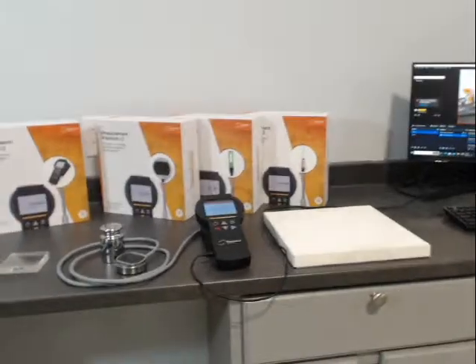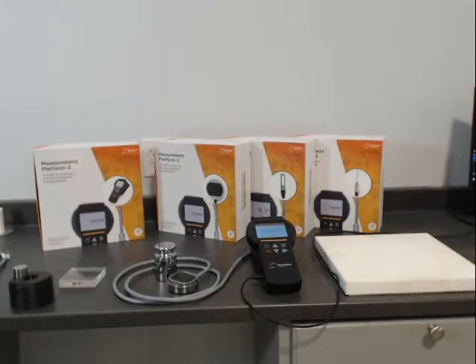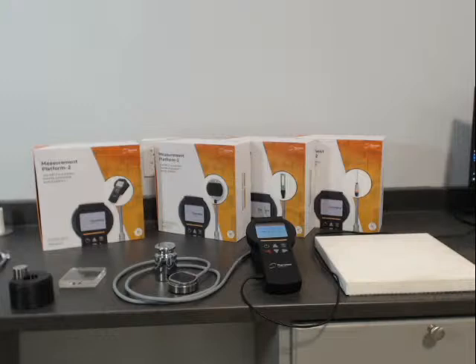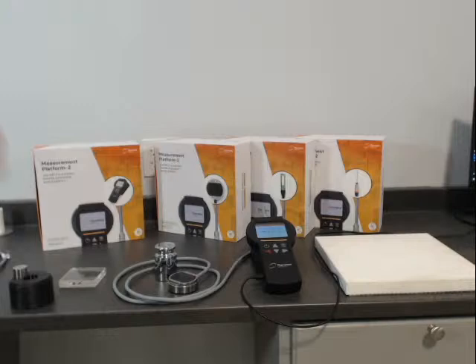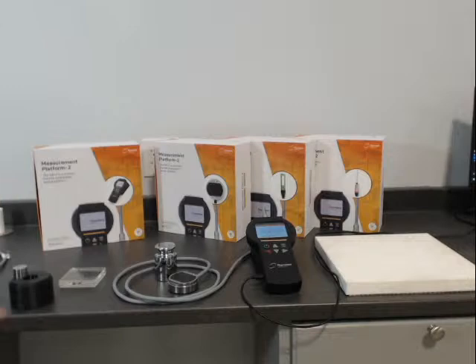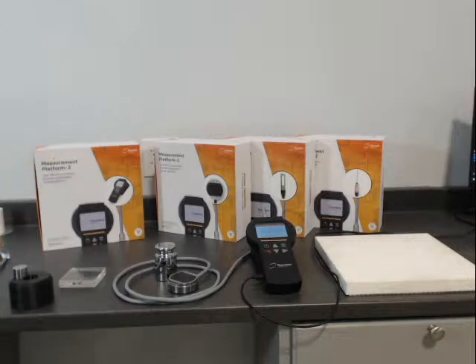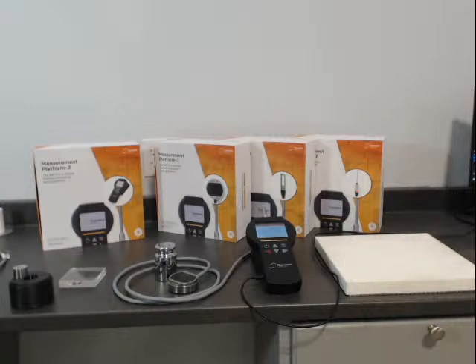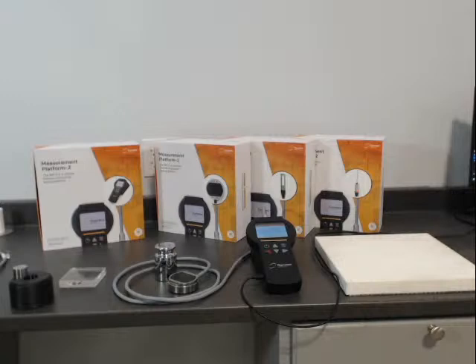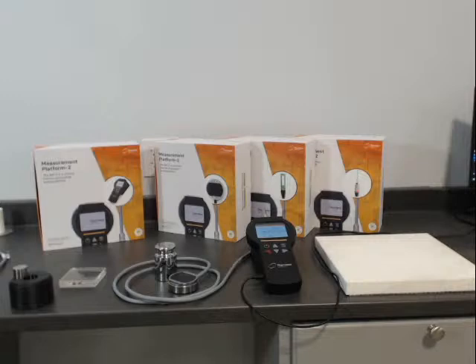Today we're going to talk about the MP2. This is a ground-up development project for a portable unit that can also be plugged into the wall and the computer. It combines several primary sensors, transient in nature, for measuring solids, liquids, and powders. So today we're going to talk a little bit about each one of them.